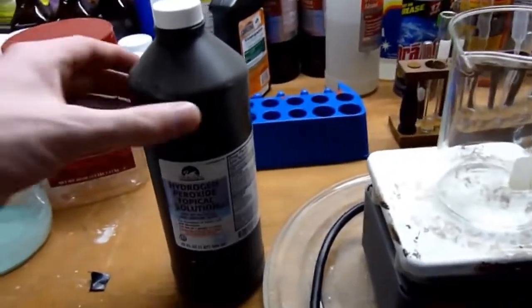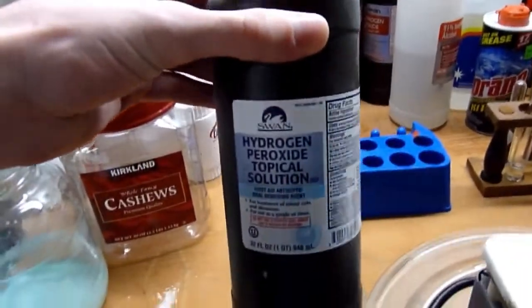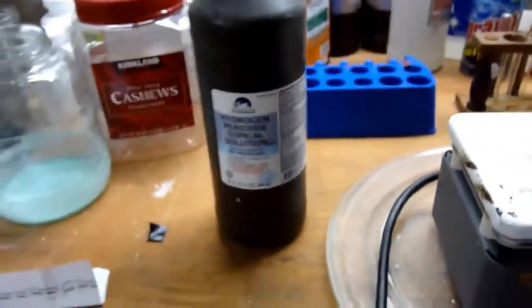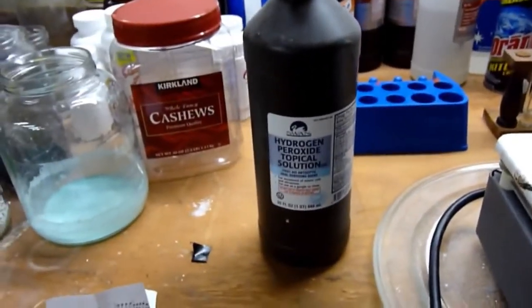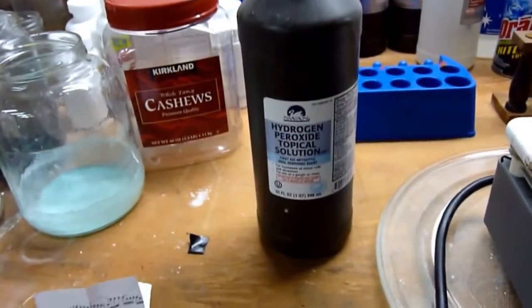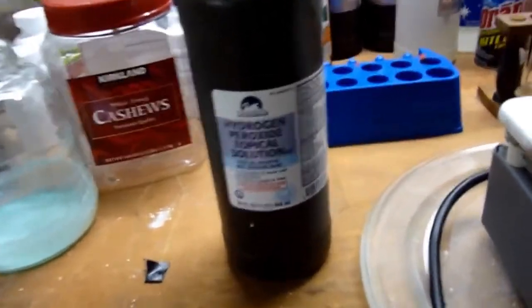In this video, we are going to be concentrating 3% hydrogen peroxide into whatever concentration we feel like. Actually, the top out is probably maybe around 35%, because then decomposition becomes a problem.